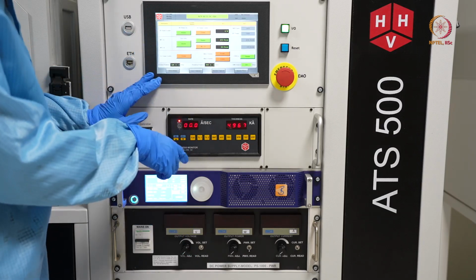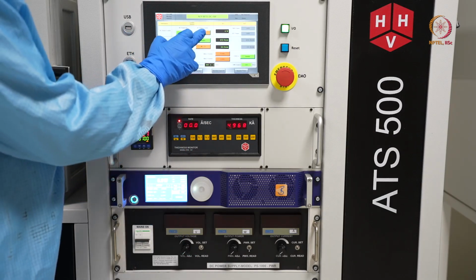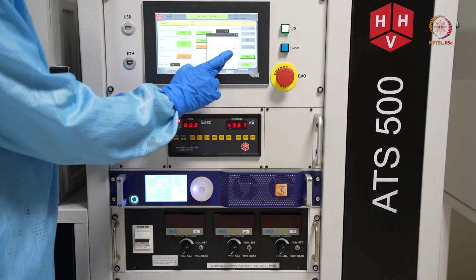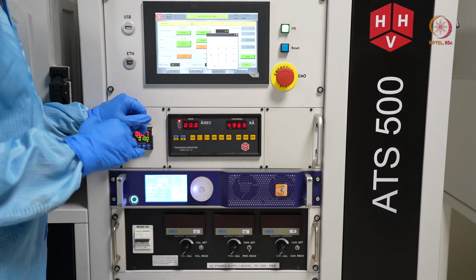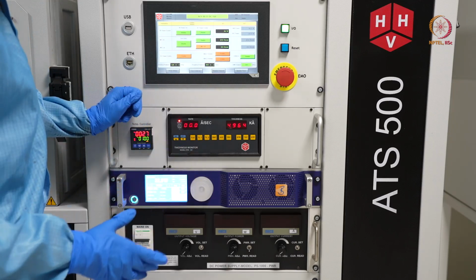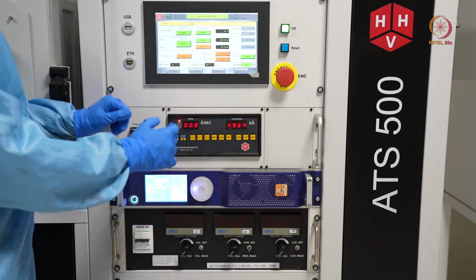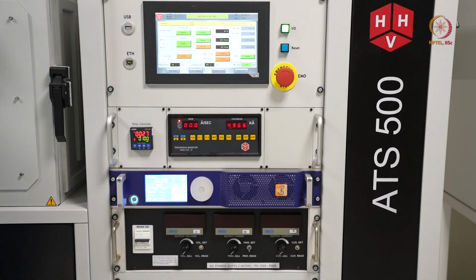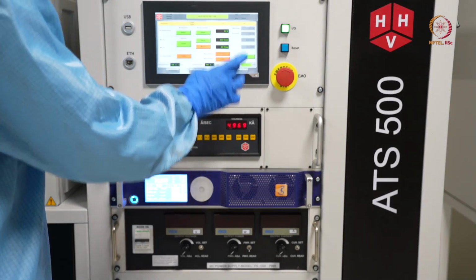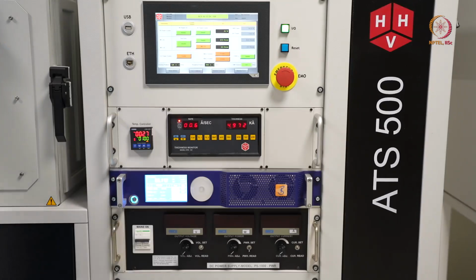First, as this is done, we have to set this RF power. Let us say we will set 30 watt. We will start with a minimum, and as this is aluminum, 30 watt should be kind of enough. It will take some time, and we will wait till it generates any plasma, or we will just increase it a little bit, 50 maybe. So you can see here what power it is actually delivering.